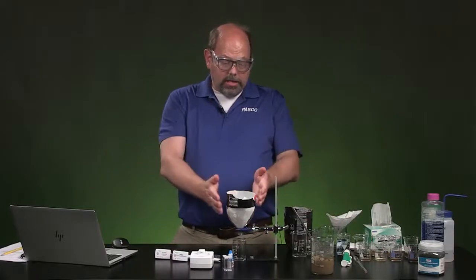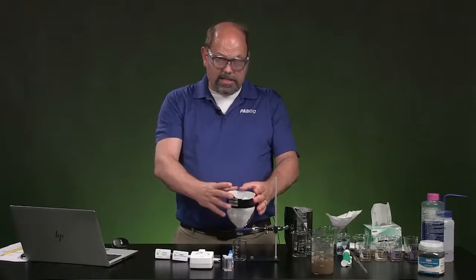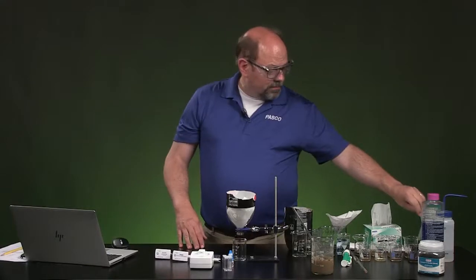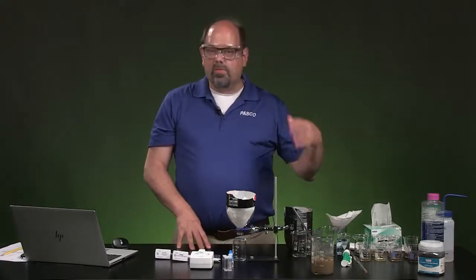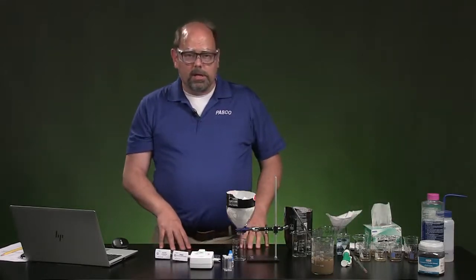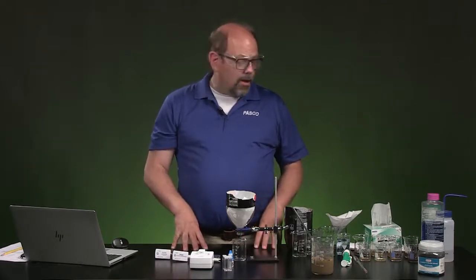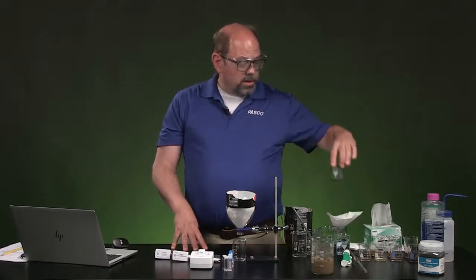Next, you can take just a 2-liter bottle and use that as a filter. It's nice because this is far bigger than, say, your typical filter funnel, but you can use a filter funnel as well. We're going to take that sample that we made of this dirty water, and we're going to put it in 4 different containers. In each of those containers, we're going to do something different to see if we can knock the substances that are in water out and make the cleanest water we can. Each of those is going to be a little different task.